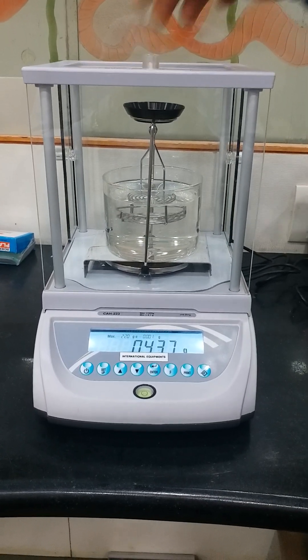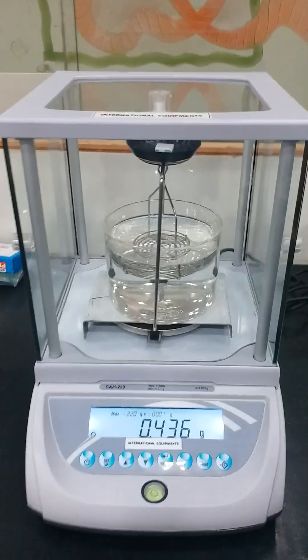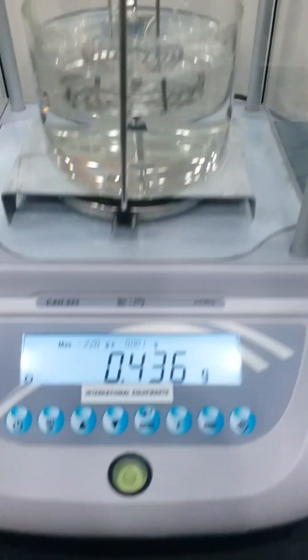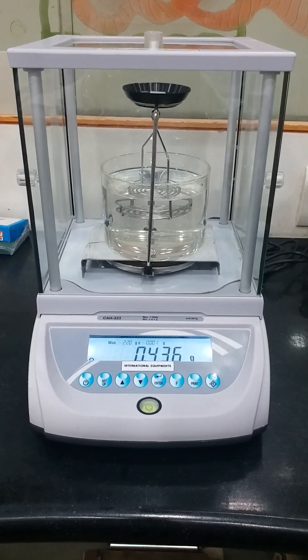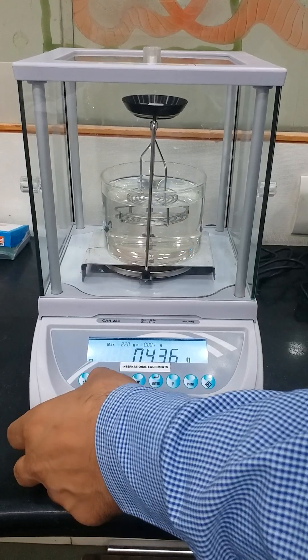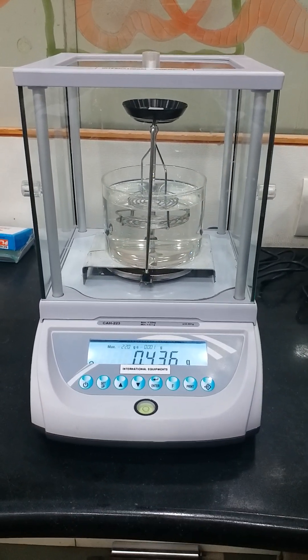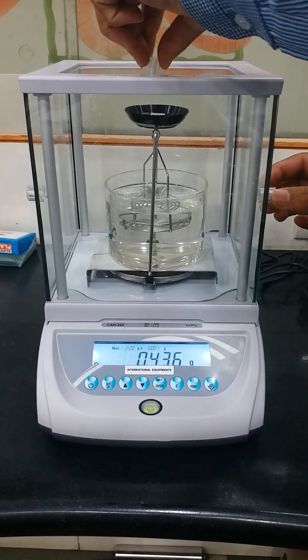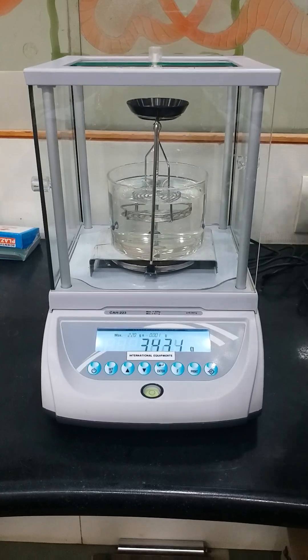Press the sample on the black top and close the top lid. Close all the lids. Now we are taking the weight in air. As you can see from the top, the sample is on the black plate and we are going to take the weight in air. Now just press Setup followed by Enter — the display will show that the first weight has been taken.